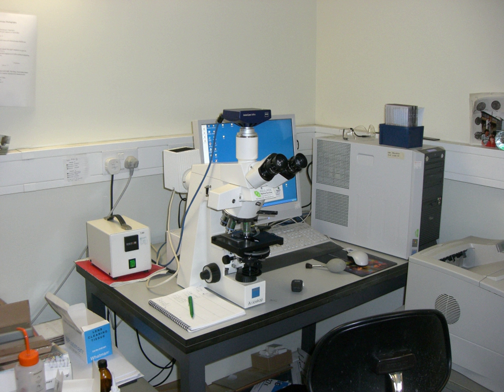Many sources of light can be used. At its simplest, daylight is directed via a mirror. Most microscopes, however, have their own adjustable and controllable light source, often a halogen lamp, although illumination using LEDs and lasers are becoming more common. Köhler illumination is often provided on more expensive instruments.